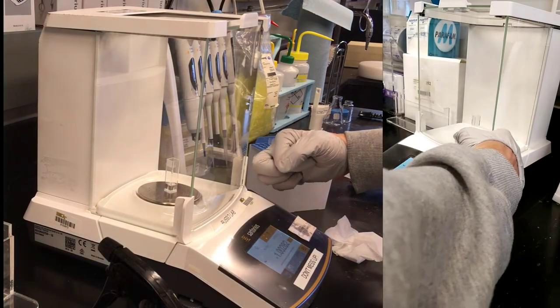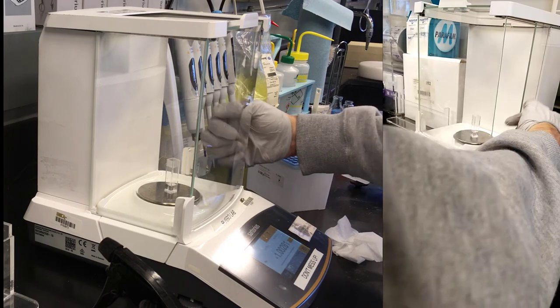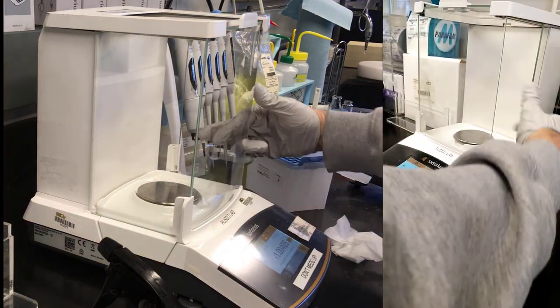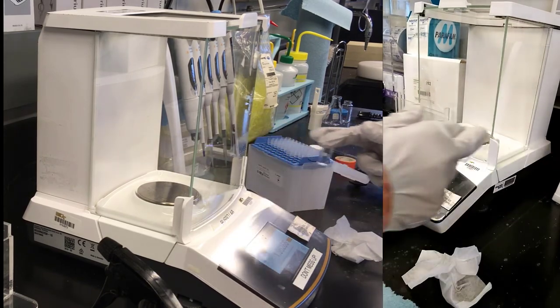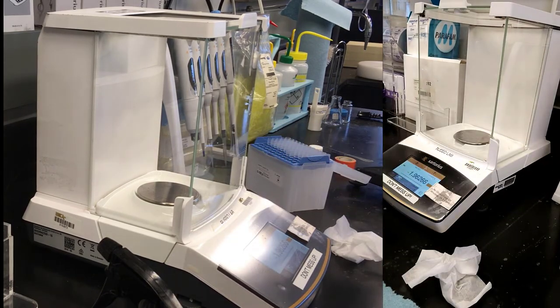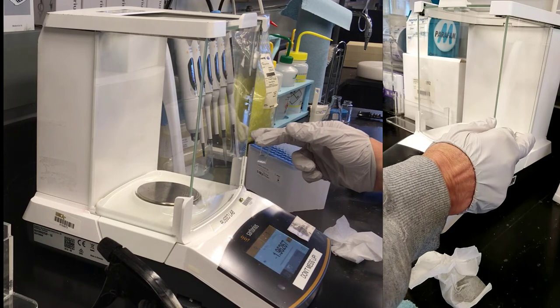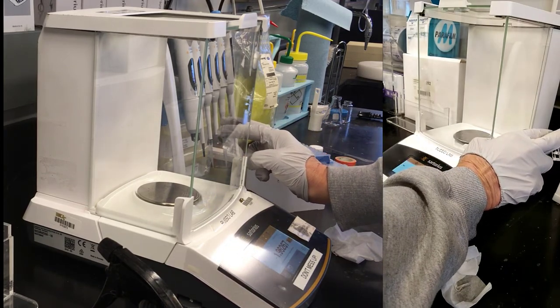You might be interested to know just how reliable that is, 1.00281. So you can just remove that. Notice that we're always very gentle with these doors. They're made of real glass. They will shatter. It'd be expensive to fix them, and what's worse, you'd have to go through GT procurement to fix them, so that's not going to be fun.